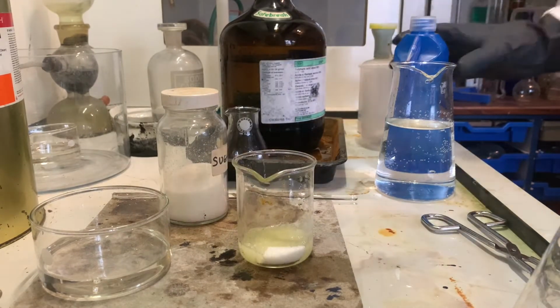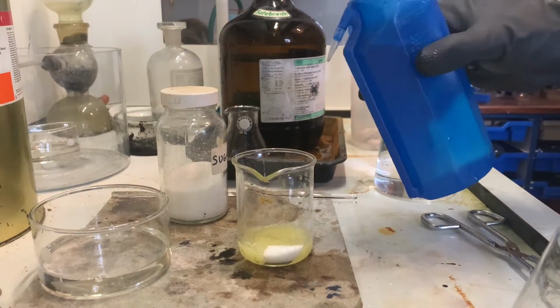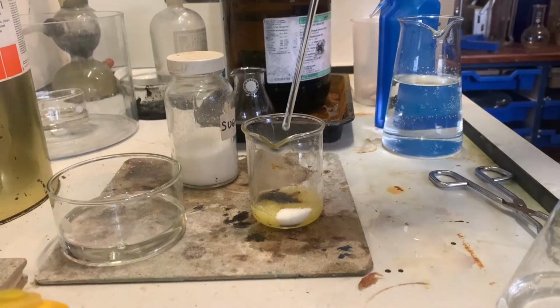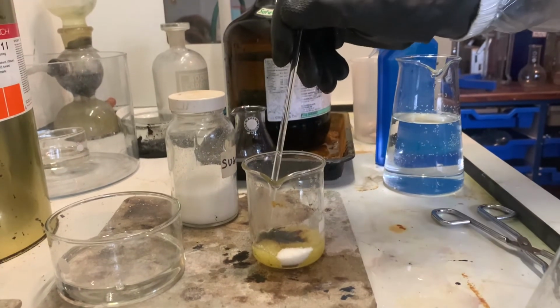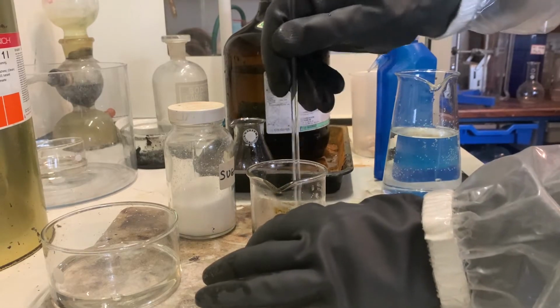Okay, there's about 20 grams of sugar in that. And I'm actually going to speed the reaction up by adding just a tiny bit of water. Now, whenever I added that tiny bit of water, there was a reaction, a heat reaction. And as you can see, the reaction started where the water is. And that's a very, very useful lesson to us.